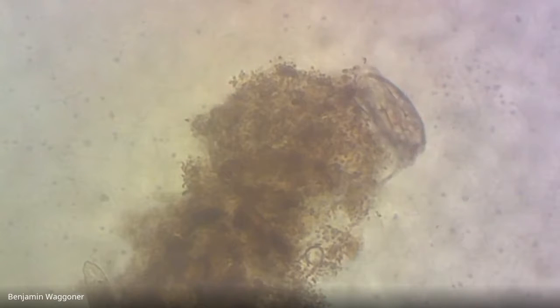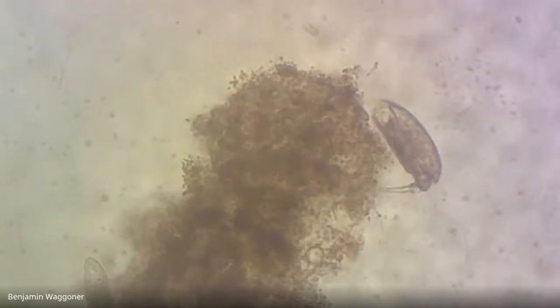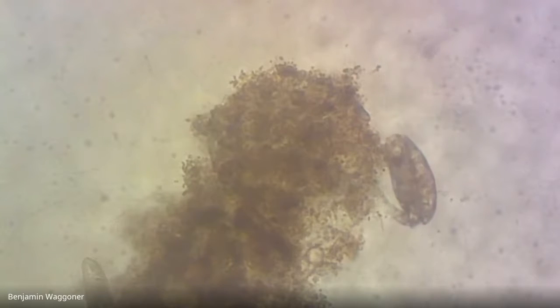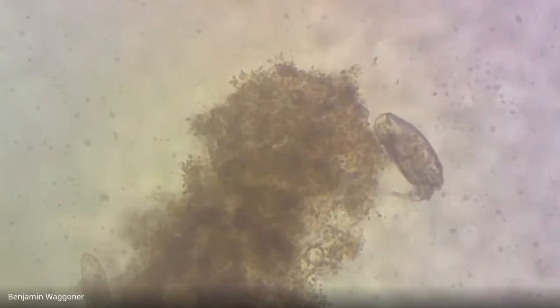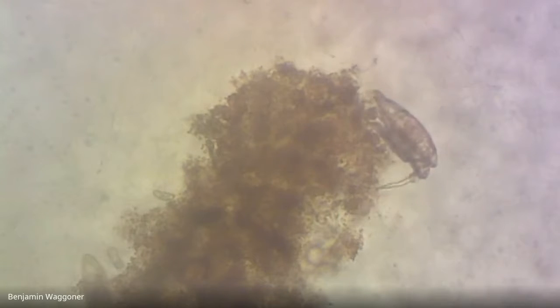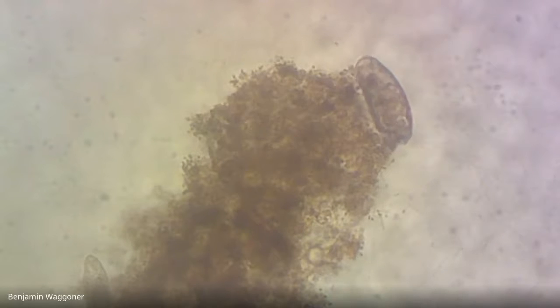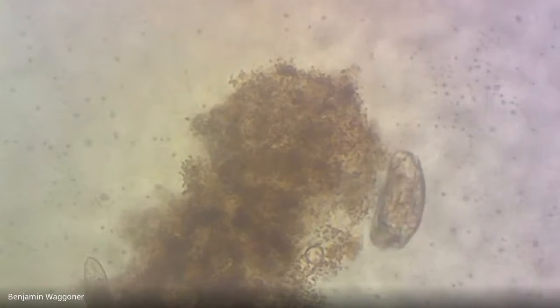And they've got cilia surrounding a mouth, and inside the mouth there's a pair of jaws called trophi that beat back and forth and crush up the food that they take in. So in this particular rotifer, you can actually see kind of towards the head end something that almost looks like a heart. If I can just get it in focus, it's just kind of clicking back and forth. There, okay, Shivam says he sees it. I assume the rest of you do as well.